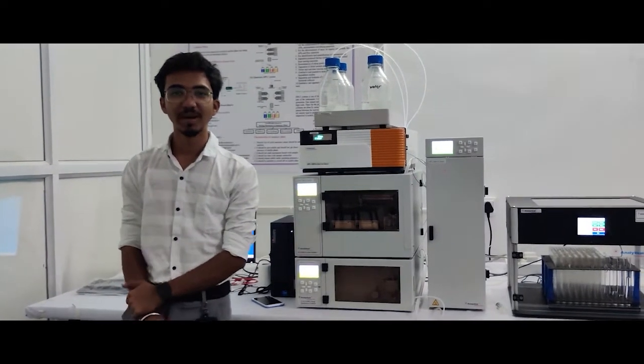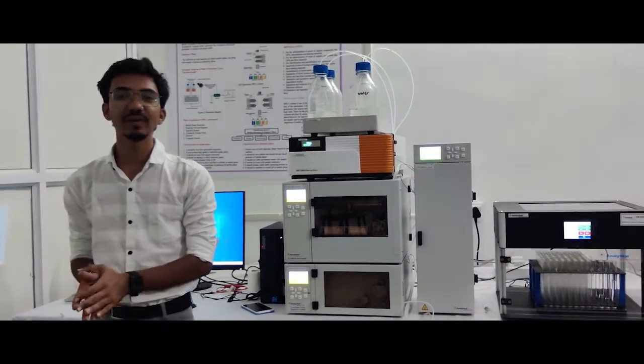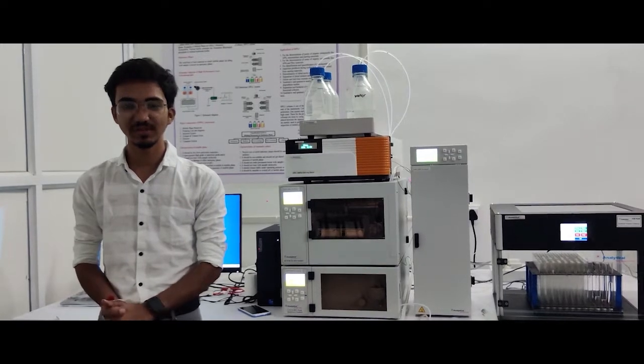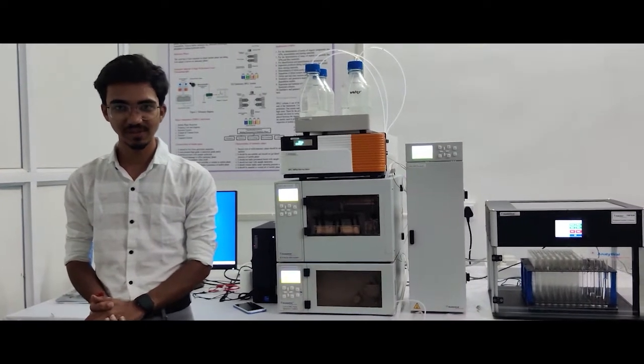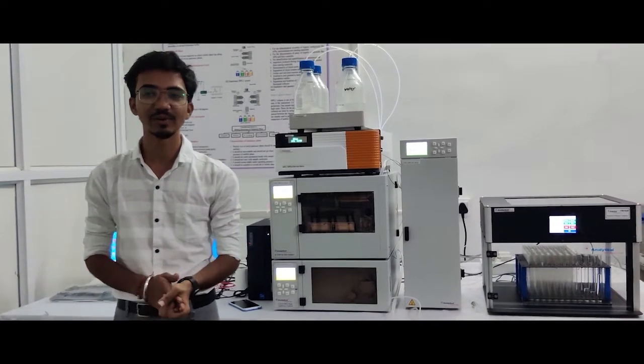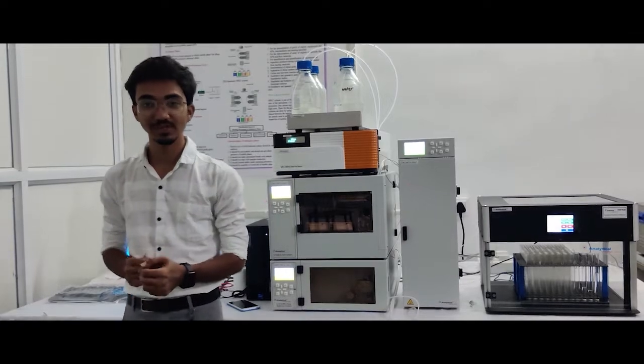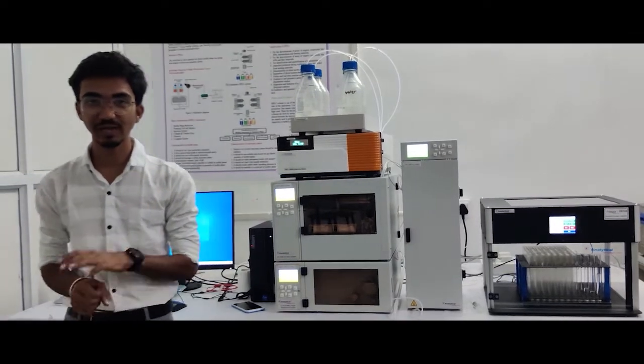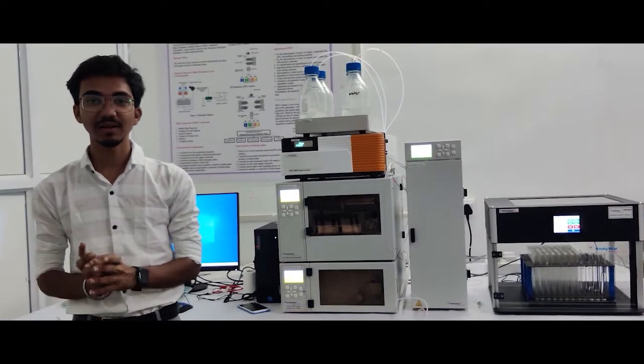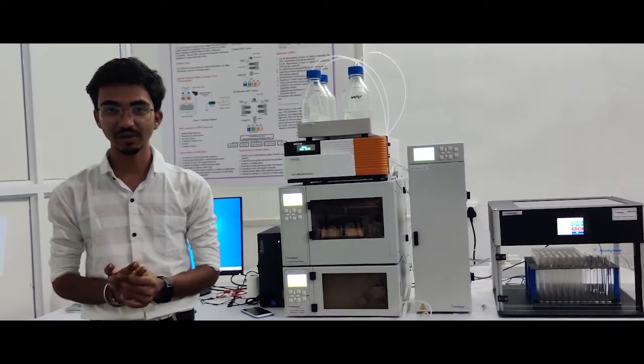Hello, my name is Rohan Paliwati. Today we have a demonstration about HPLC. HPLC means High-Performance Liquid Chromatography. The HPLC is used for liquid separation and identification.